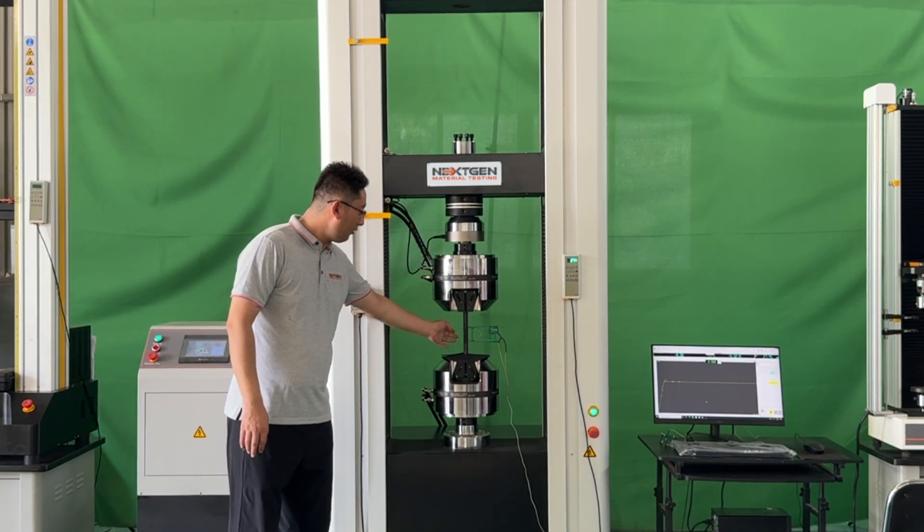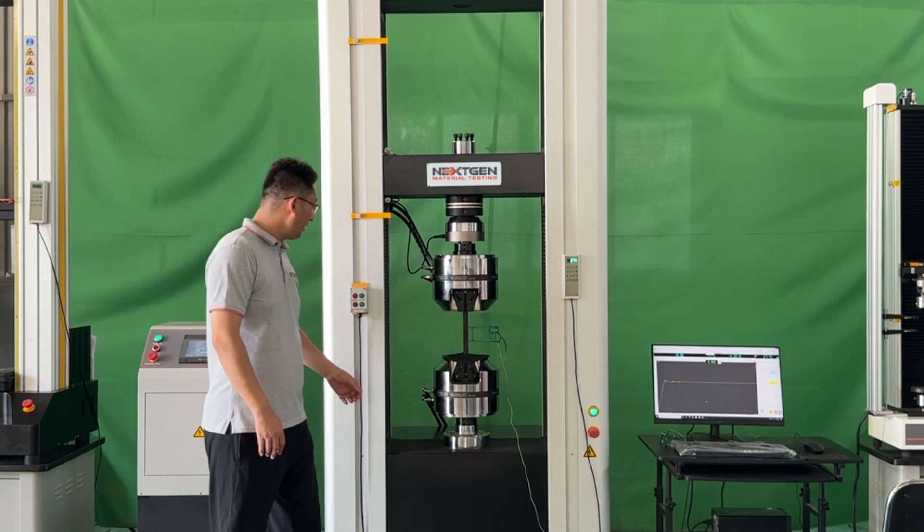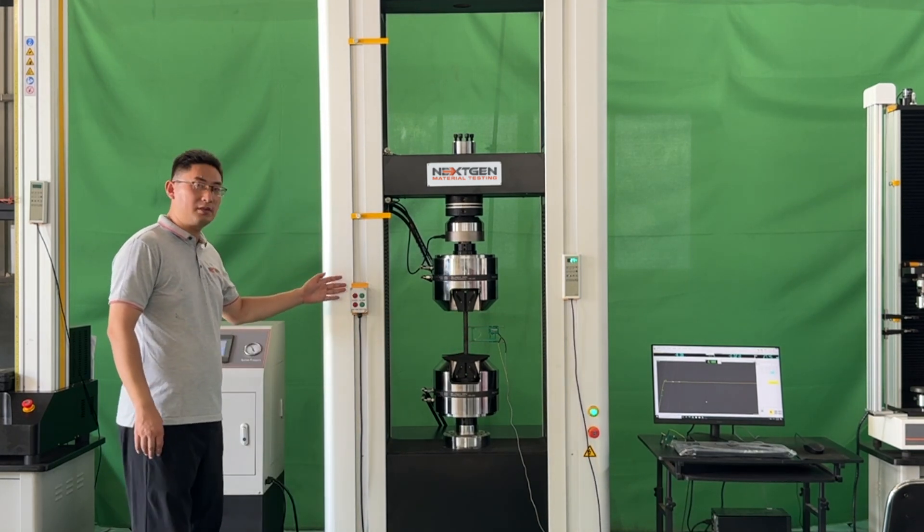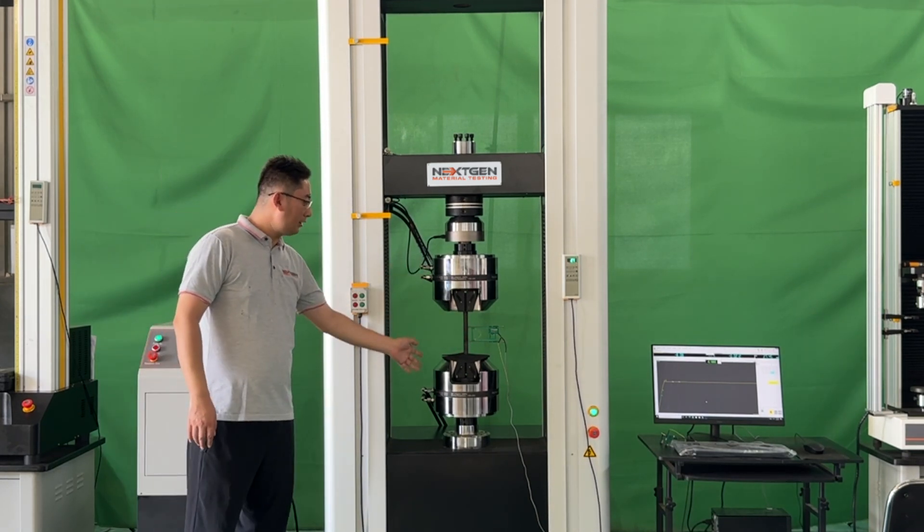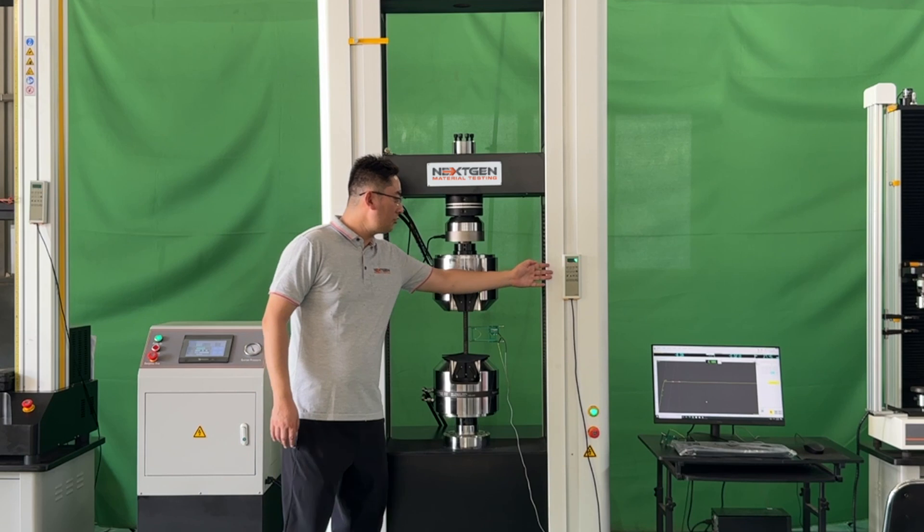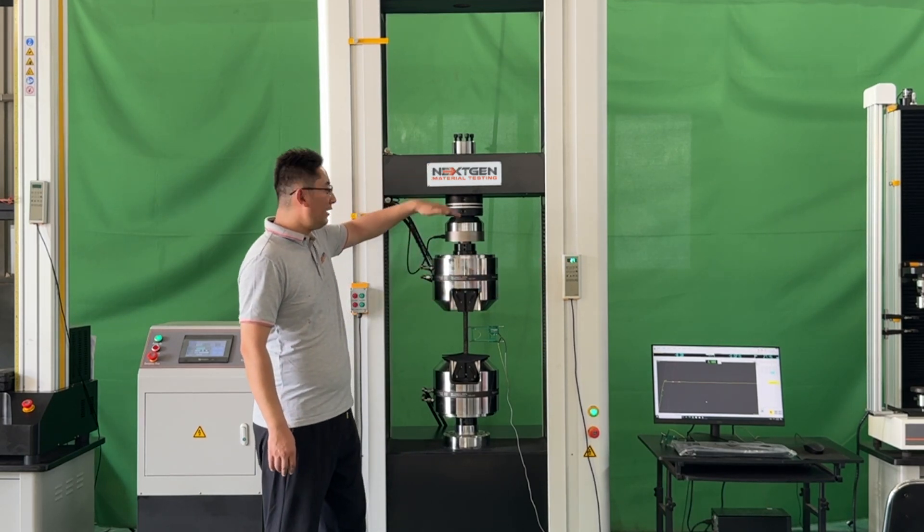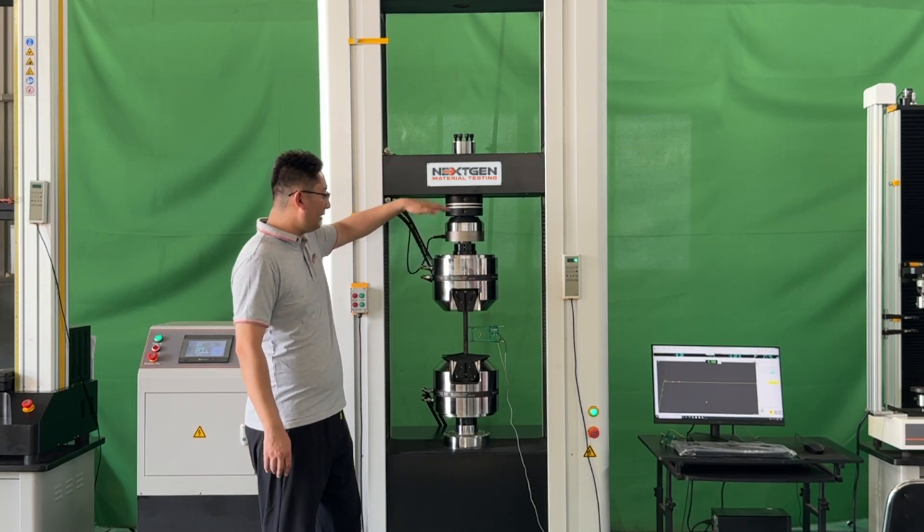Inside you will see a metal rebar sample. The hand controller on the right operates the upper and lower grips. The hand controller on the left moves the upper beam up and down.